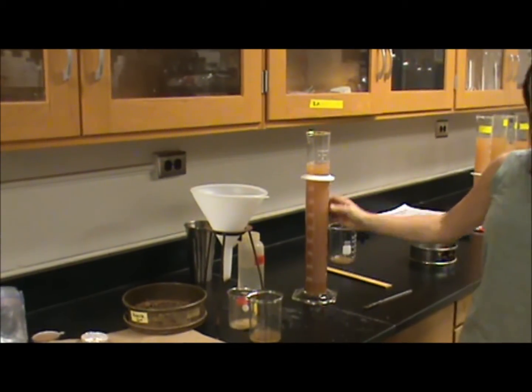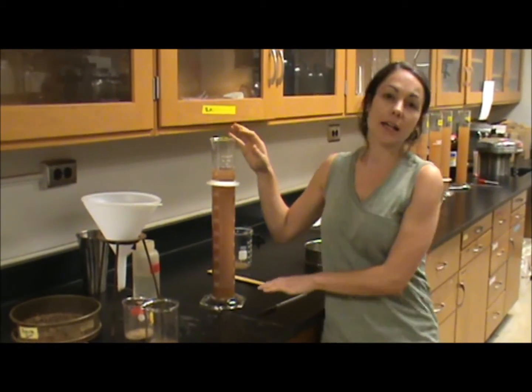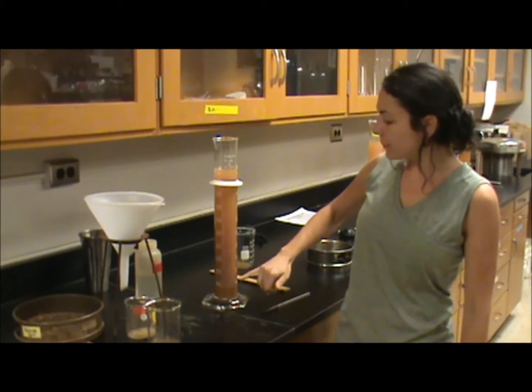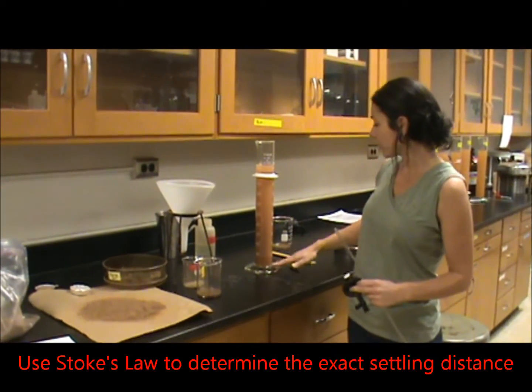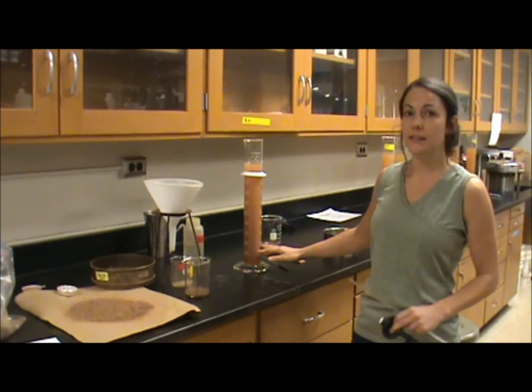After you mix the soil in the graduated cylinder, you're going to wait at least 7 hours, come back, and you will be able to determine the percent clay. After 7 hours, all the silt in your sample will have settled to the bottom of the graduated cylinder, and all your clay will be left in suspension.